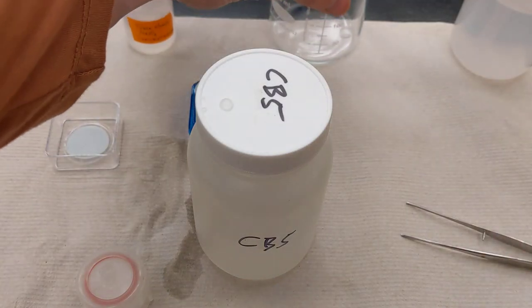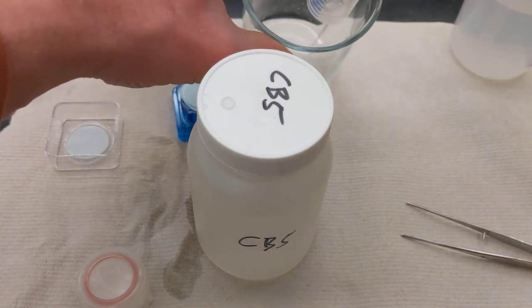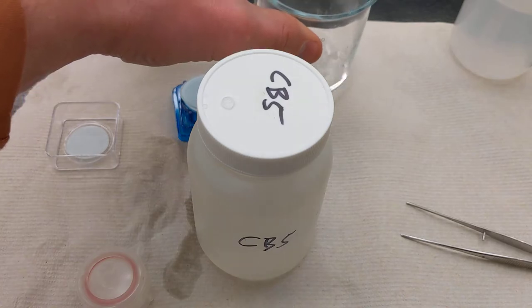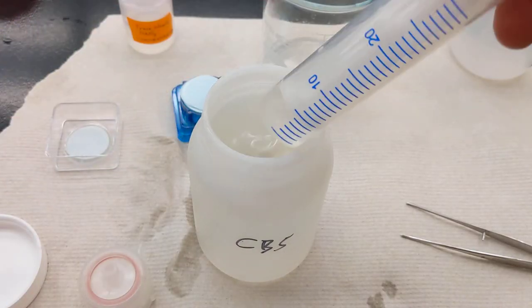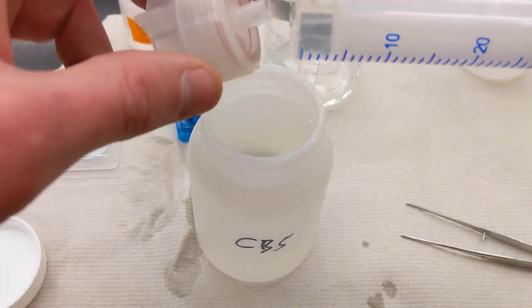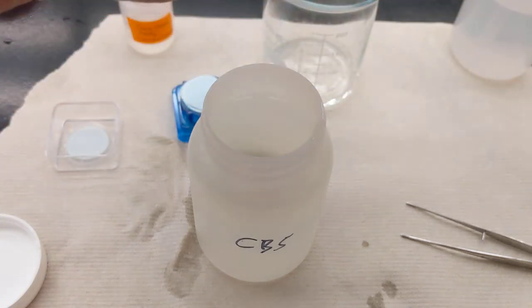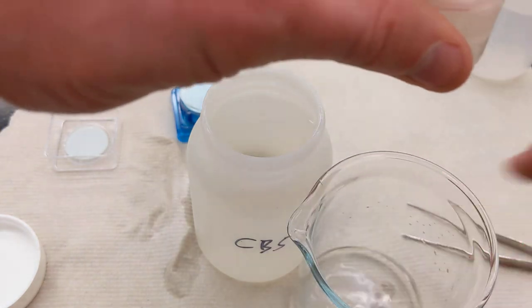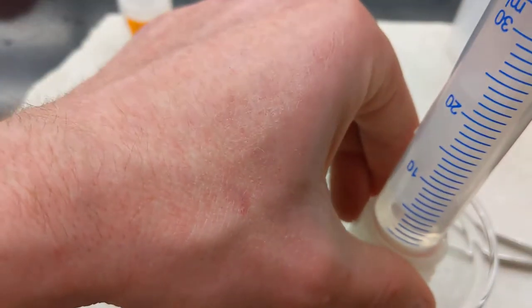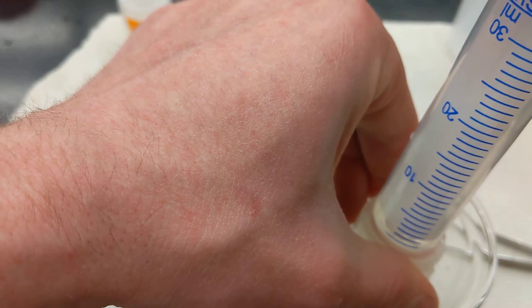I'll take this, expel this into a waste beaker back here. Then I'm going to do one more small draw of just a couple mils here, and I'm going to push this on.